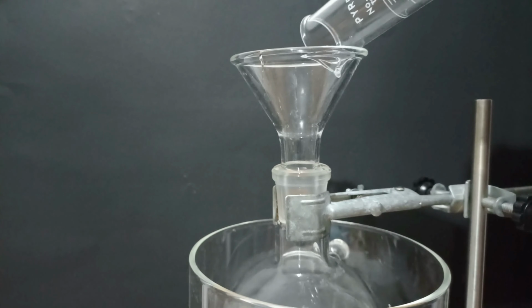I basically created matter. Nah, the product is just wet, so I'm going to dry it out. I heated it for 40 minutes to 80 degrees Celsius. But it wasn't enough.